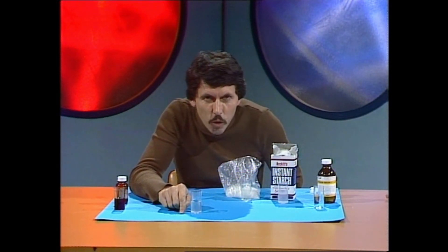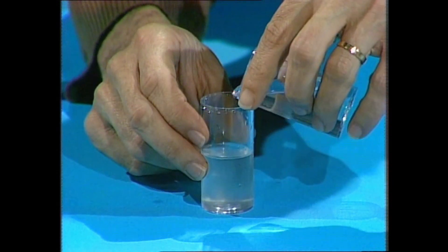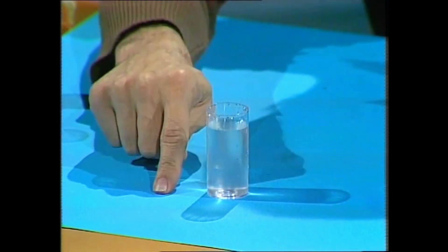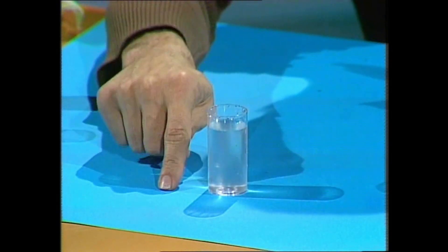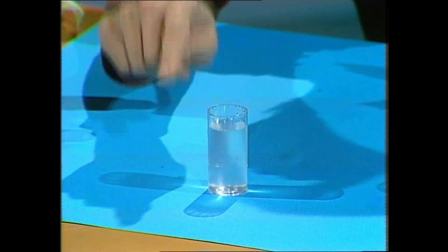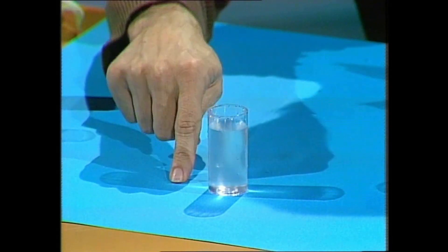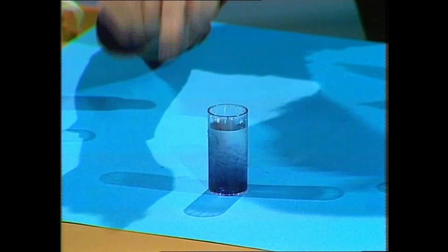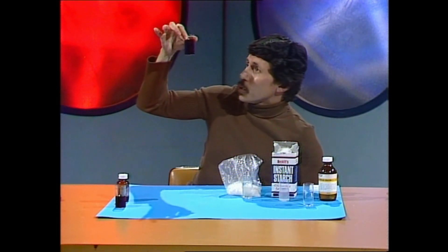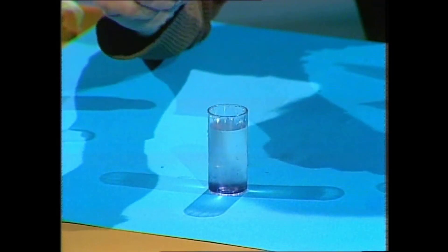1, 2, 3... [counting to 22] ...well, I said it was a number 22 and it certainly was, wasn't it! How on earth did that happen? Well, I mixed some chemicals together — four simple chemicals actually.